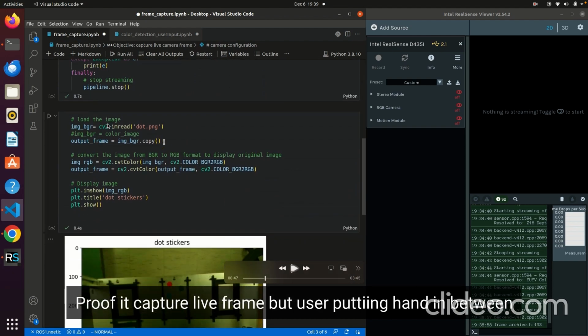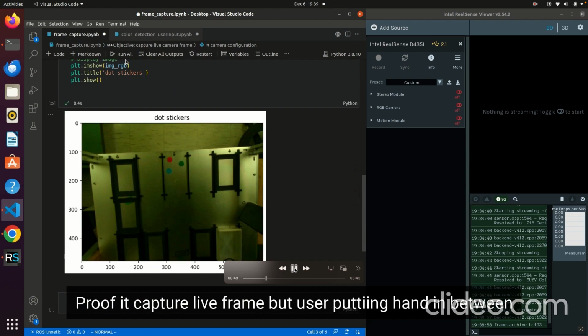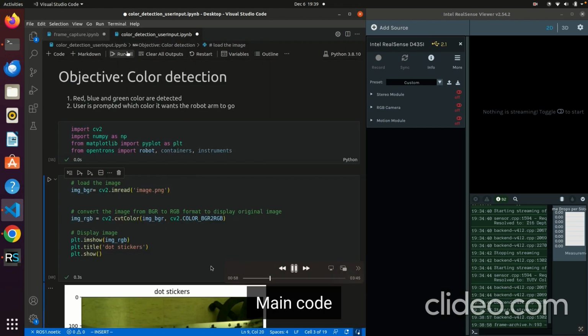And this is the code to load the image. So I'm gonna quickly go over the proof that it gets the live frame as you run the code by putting my hand in between. So here you could see a proof that it works, and we run that again.